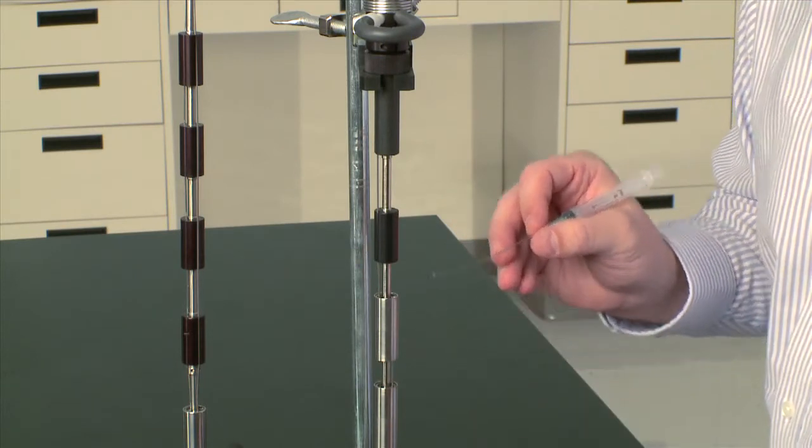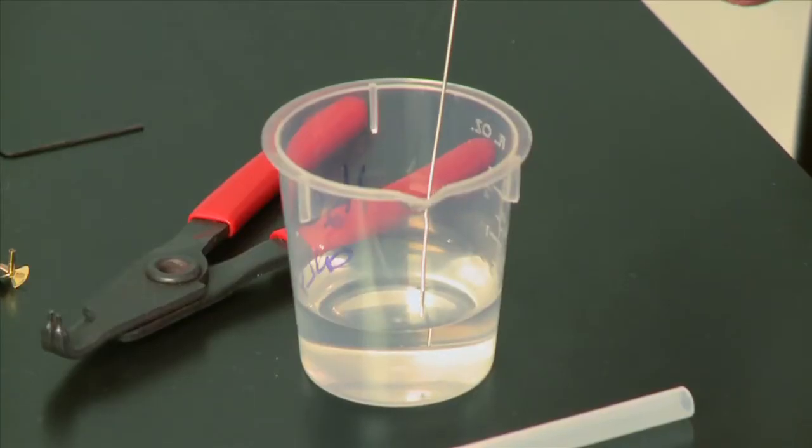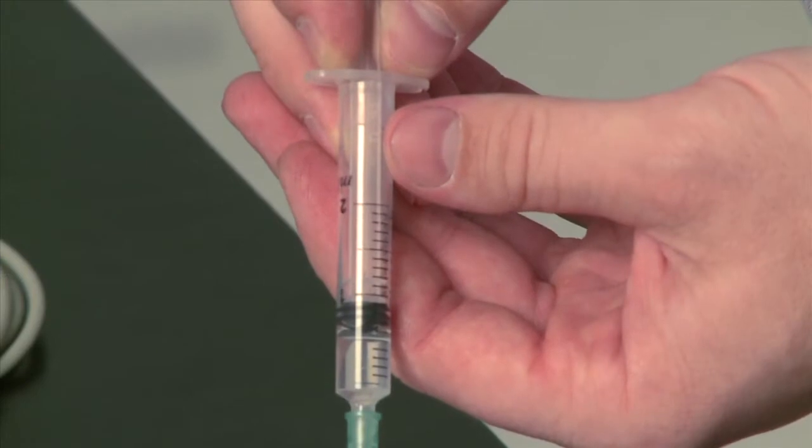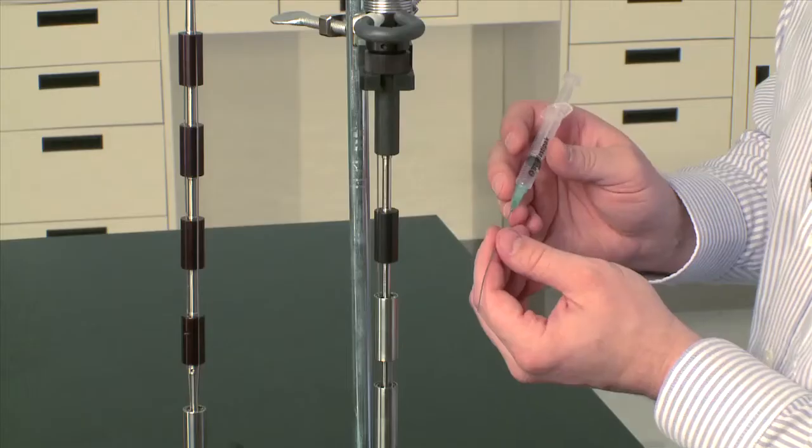Now you have access to the relative humidity chamber. I'm going to fill this disposable syringe with about half a milliliter up to about 0.8 milliliters. You can fill it completely full with 0.8 milliliters of water.